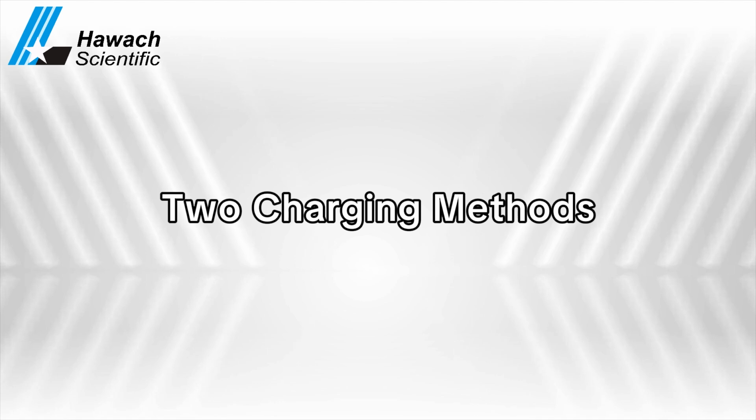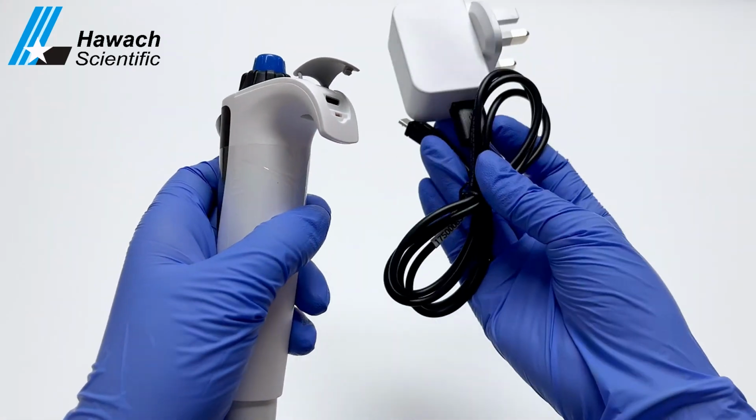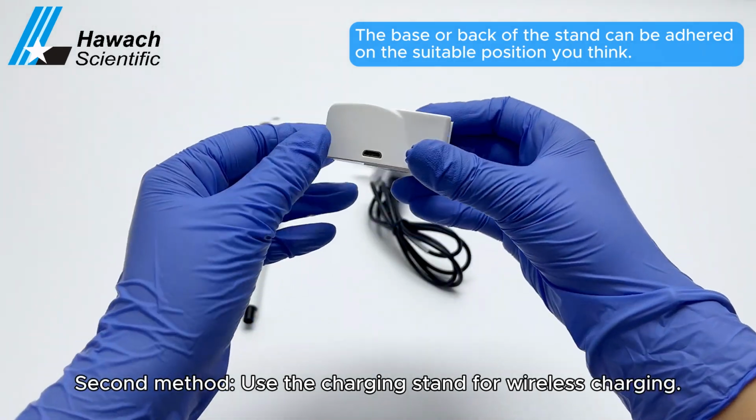Charging methods. First method, charge directly by plugging in the power cable. Second method, use the charging stand for wireless charging.